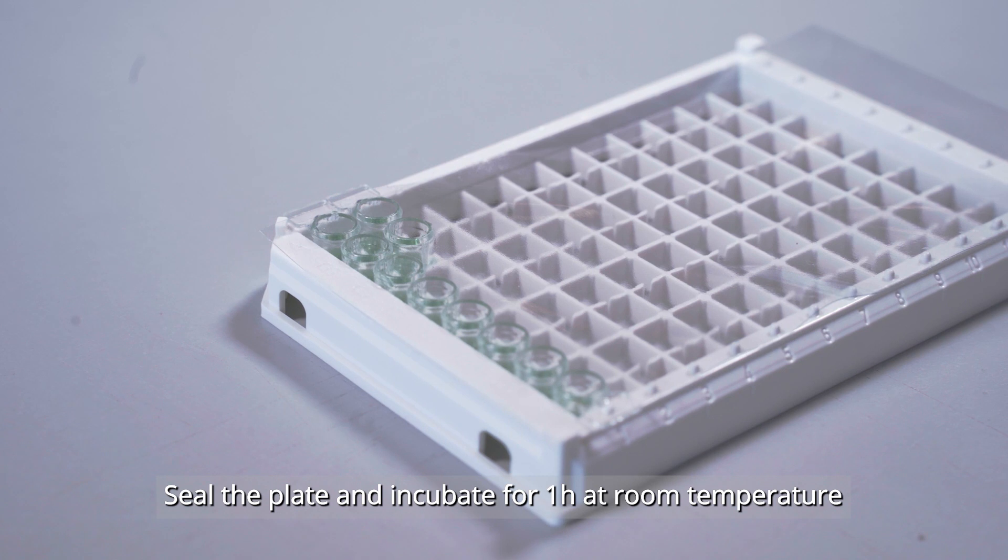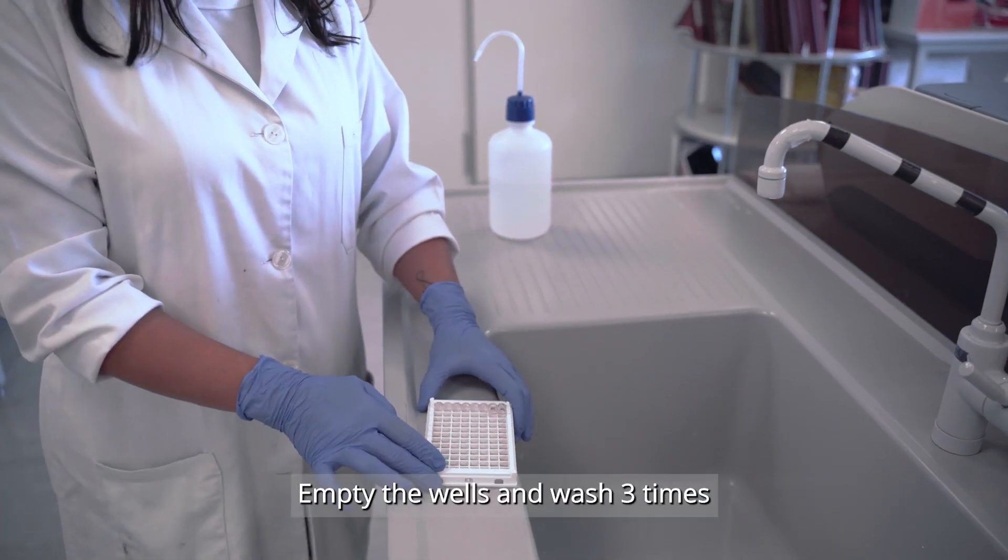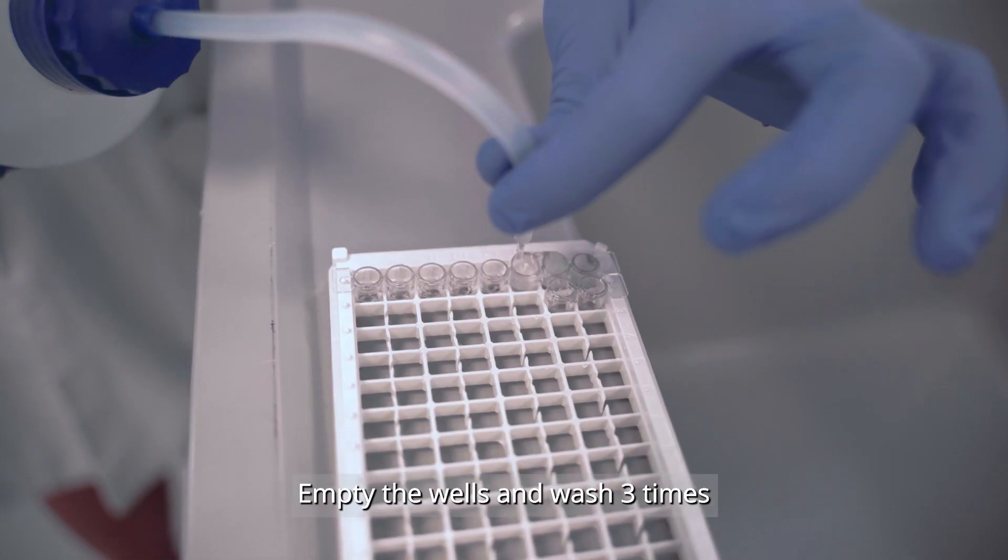Seal the plate and incubate one hour at room temperature. Empty the wells and repeat the washing step three times.